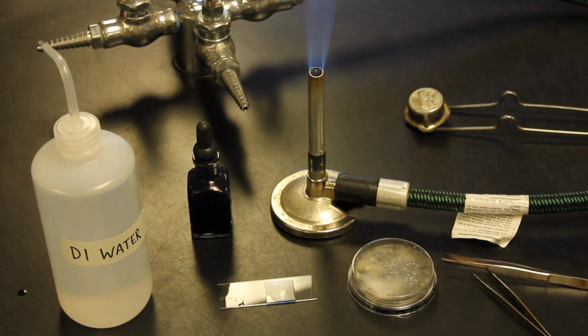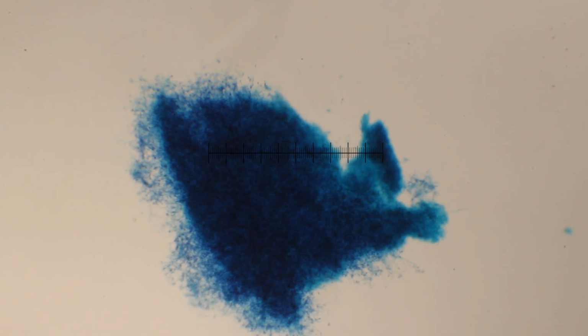Alright, I'm going to show you the slide of the fungus sample. The fungus sample was taken from the contact plate, from the keyboard, and was stained with lactophenol cotton blue. This is the 4x objective. I'm now going to shoot in the 10x objective, and we'll focus under the 10x objective. We will now swing in the 40x objective. We'll increase the light, and we'll move to the edge where we can actually see some of these structures here.